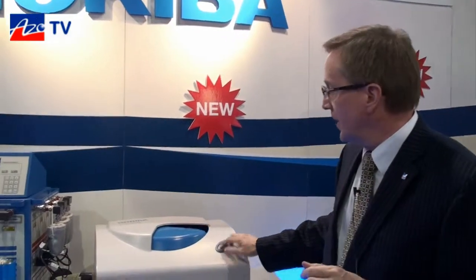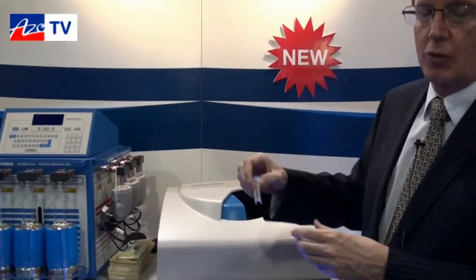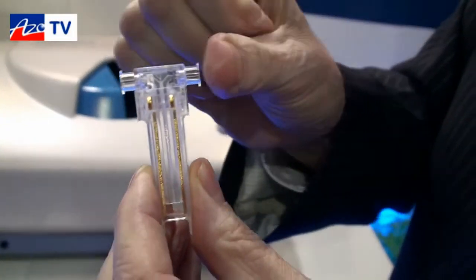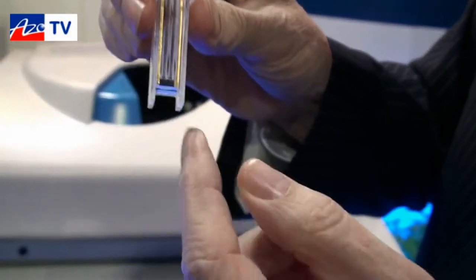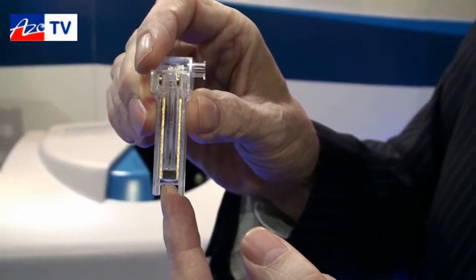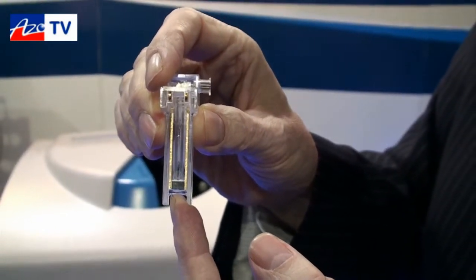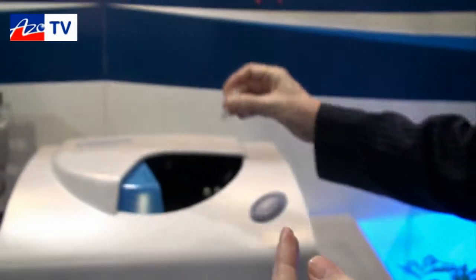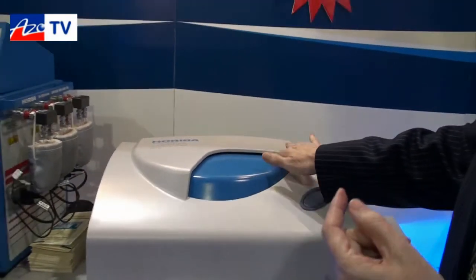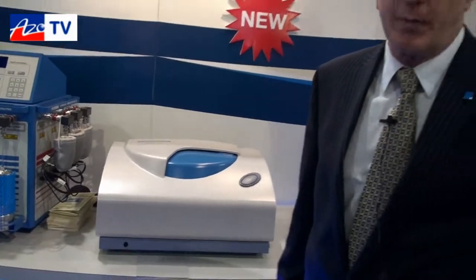For measuring zeta potential, that is the cell I had shown you earlier. This is a disposable cell — we inject the sample into the cell, and between these two electrodes we create an electric field, measure the mobility of the particles, and from the mobility calculate the zeta potential. We simply place the zeta potential cell in the instrument, it creates that electric field, and in a minute you will have your results — the zeta potential, that charge on the surface.